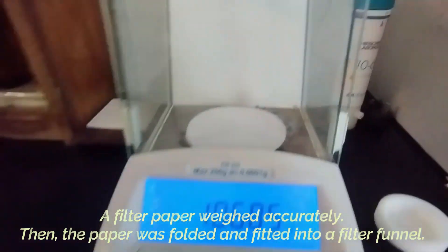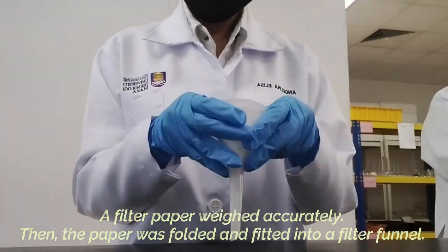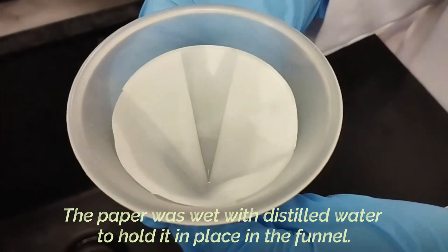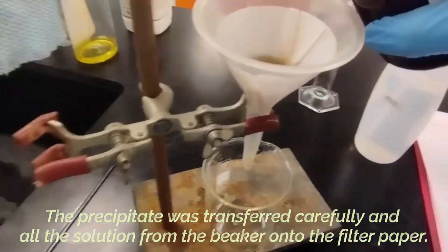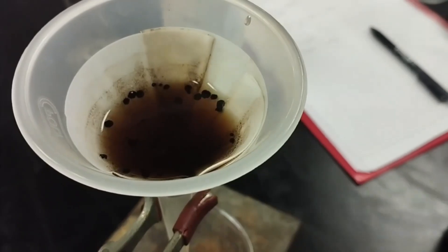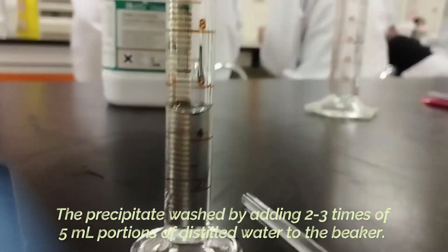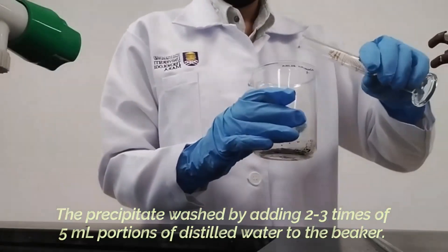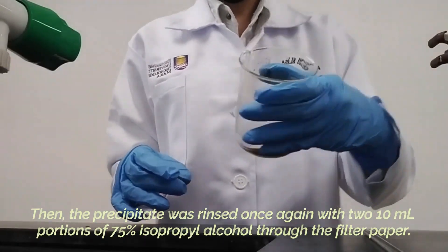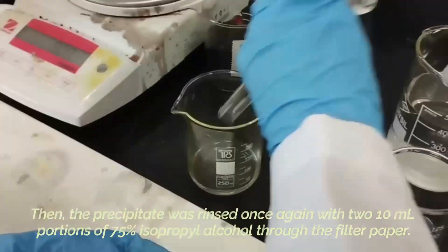A filter paper was weighed accurately. Then the paper was folded and fitted into a filter funnel. The paper was wetted with distilled water to hold it in place in the funnel. The precipitate was transferred carefully along with all the solution from the beaker onto the filter paper. The precipitate was washed by adding 2 to 3 times of 5ml portions of distilled water to the beaker.